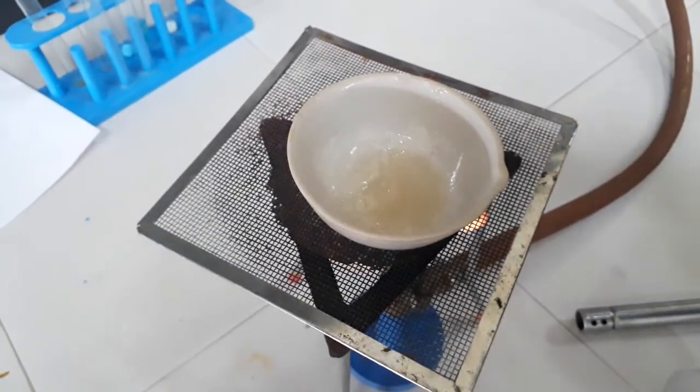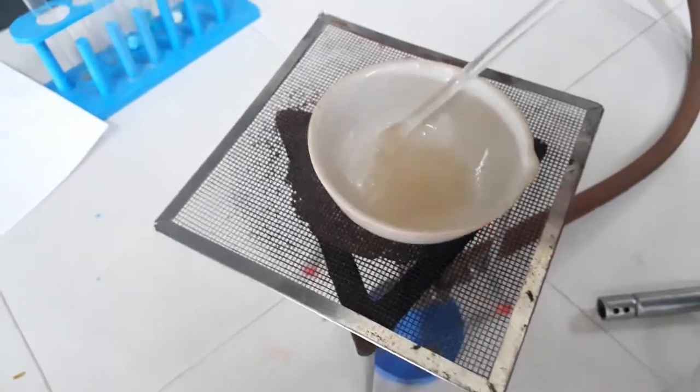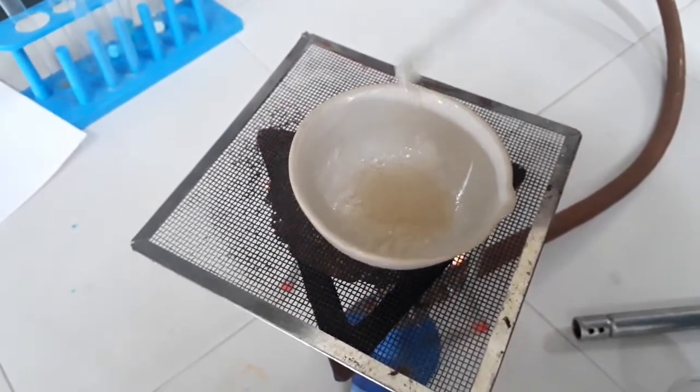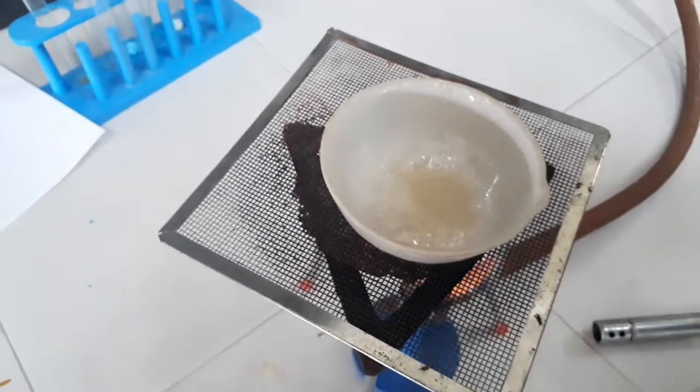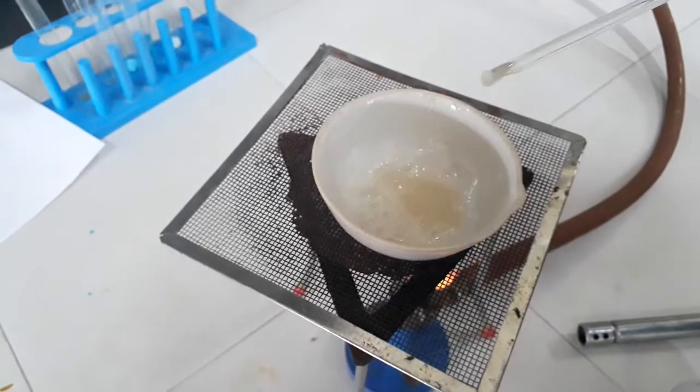We can see the proof that after heating, water can be seen easily. That's why it is proof that water of crystallization is present in alum. This alum has a lot of uses, medicinal use, and it is used for cleaning water.